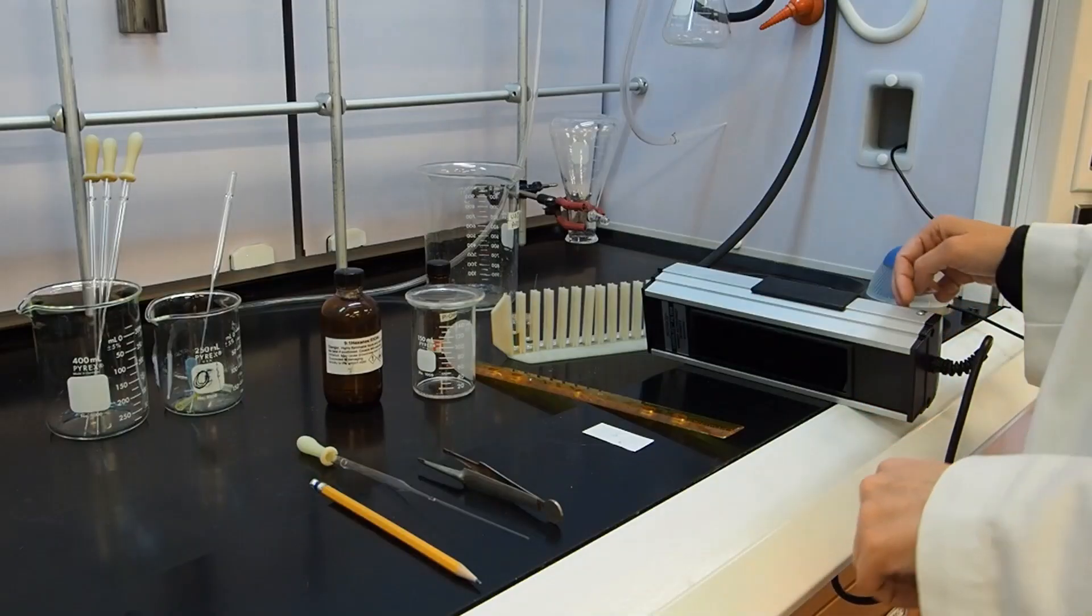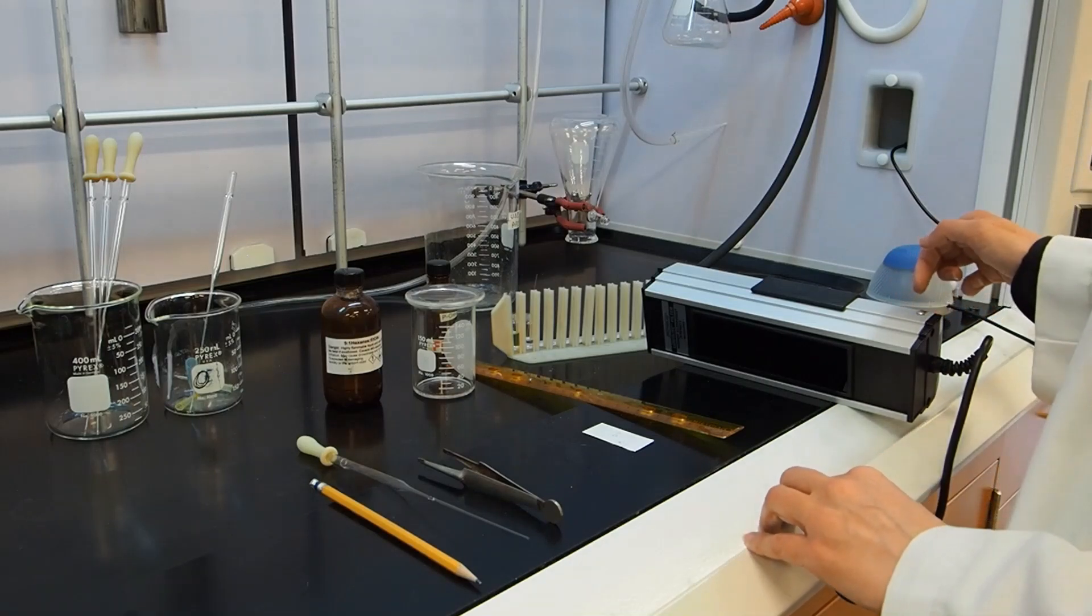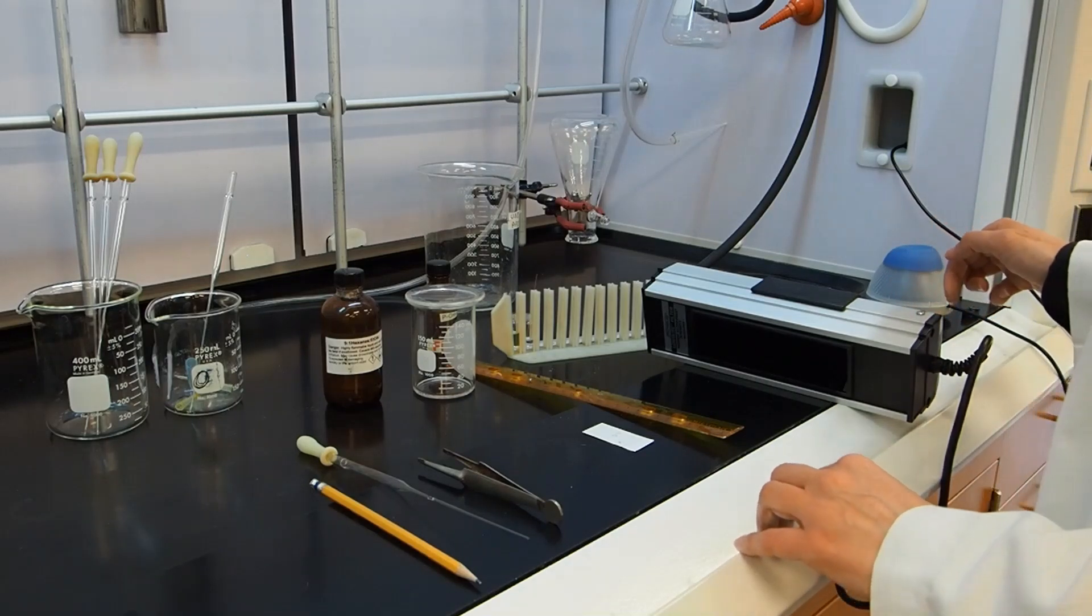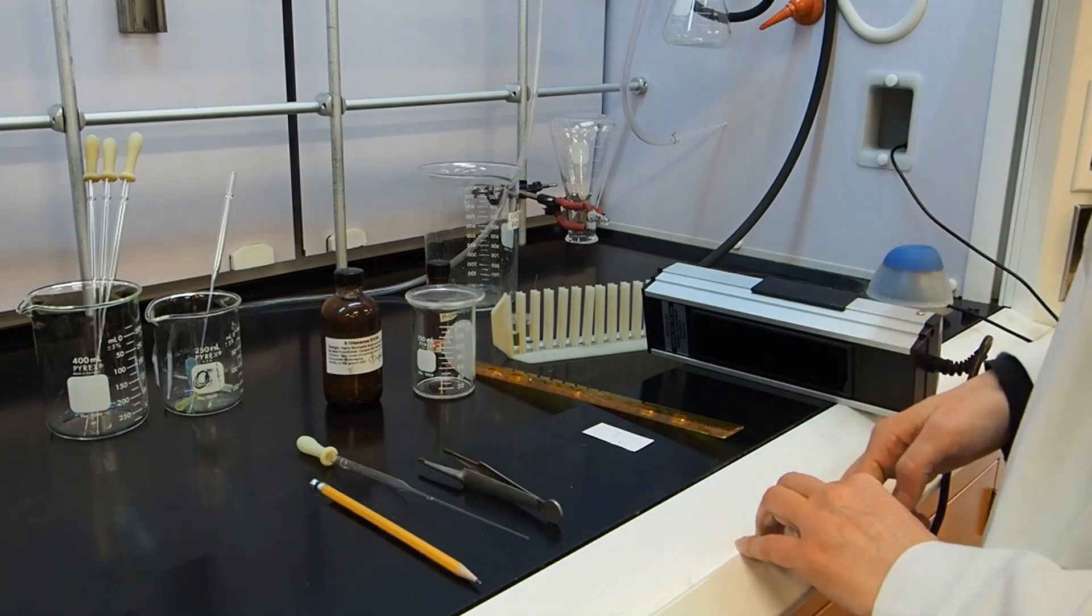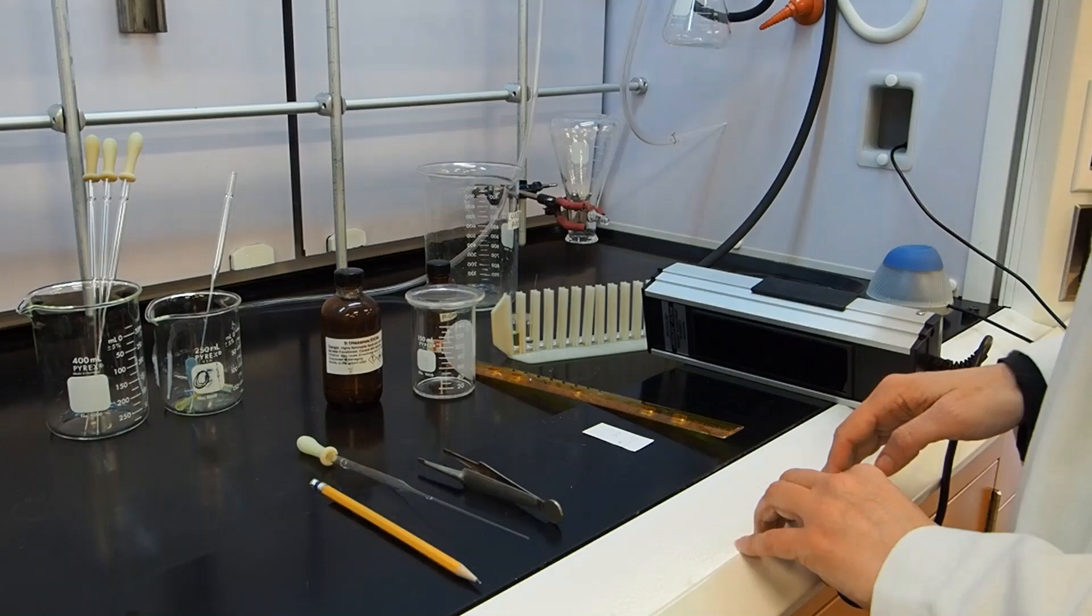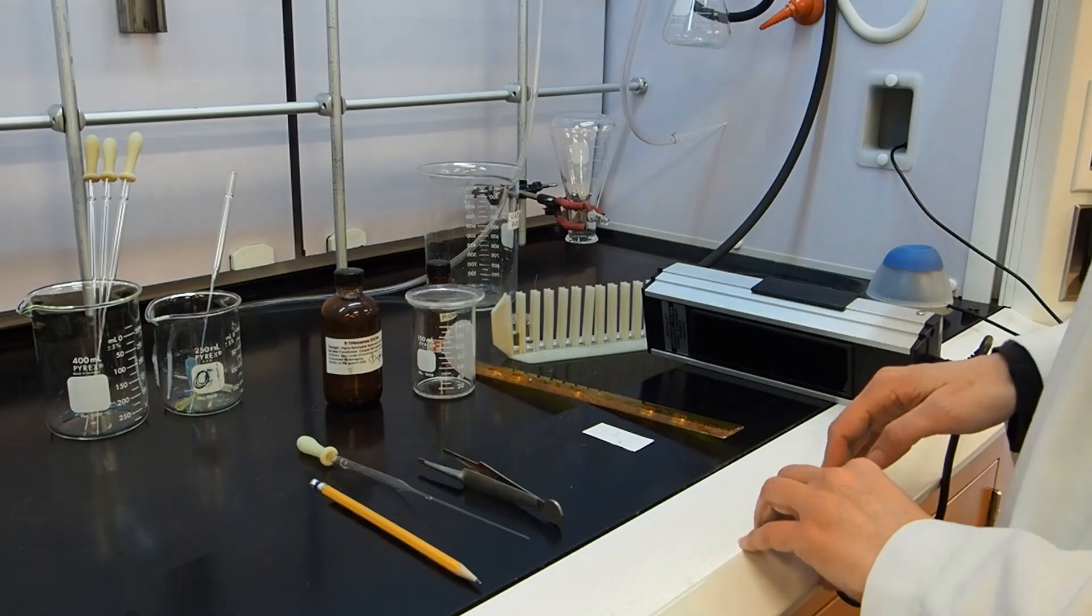From the TLC, we can see that the reaction has finished. So even though it hasn't been 60 minutes, I'm going to go ahead and turn off the heat and lower the oil bath and allow the reaction to cool.